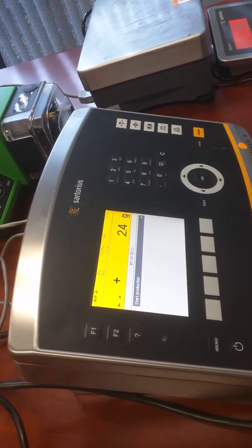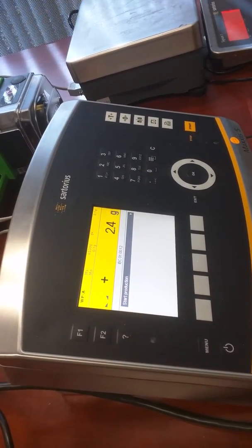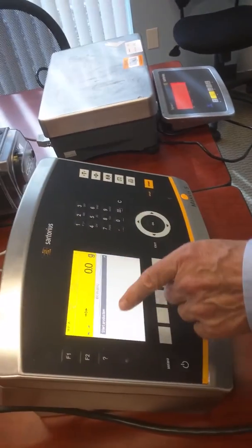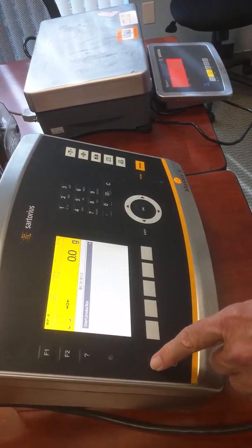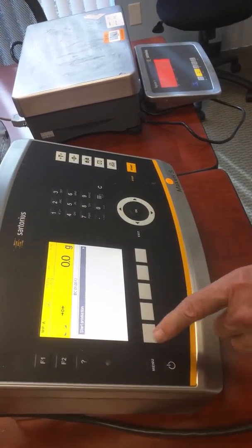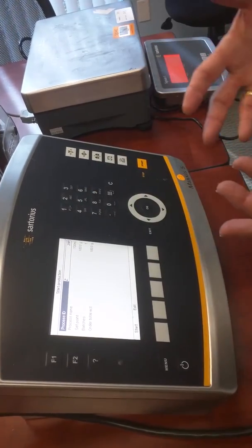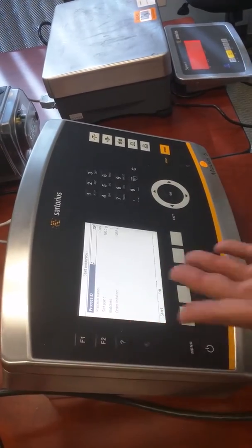That's just a tare value, it looks like. I'm just going to tell it that's 0 because that's okay. Okay, start production. So if we hit start right now, if I had a foot switch here, I could do that. Now, that 20p was the name of the 100 mil fill. You could pick other fills, choose which one you're going to do, and it will run that.